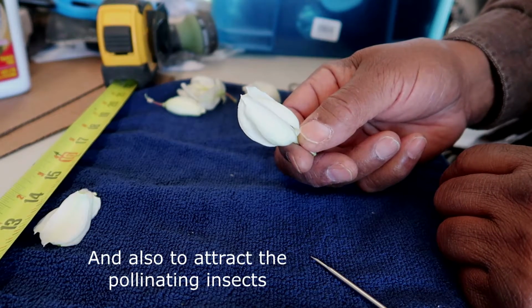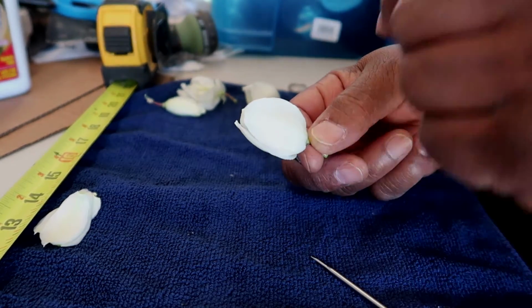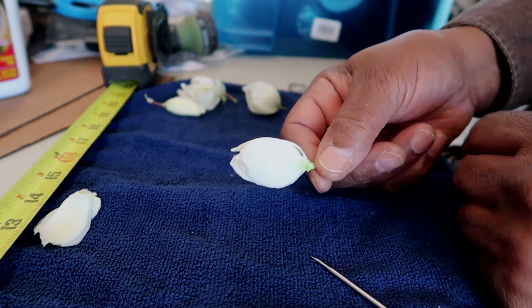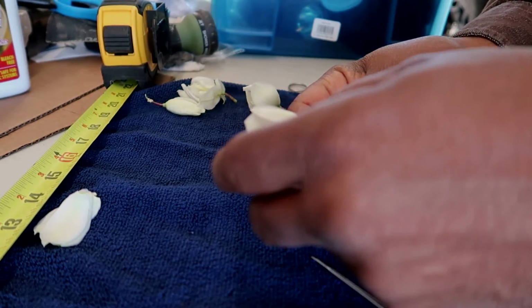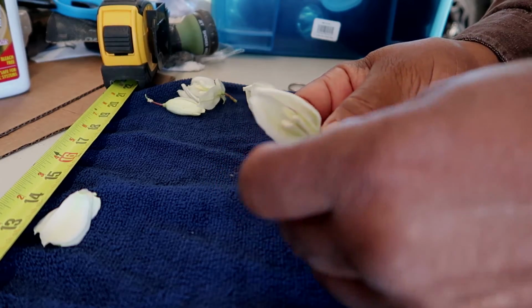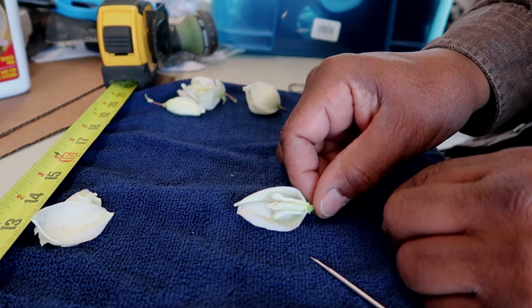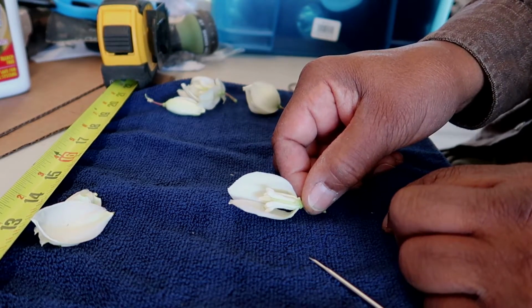In order to see the reproductive portion, we'll have to remove at least one of these petals. And voila, we have the inside of the flower.